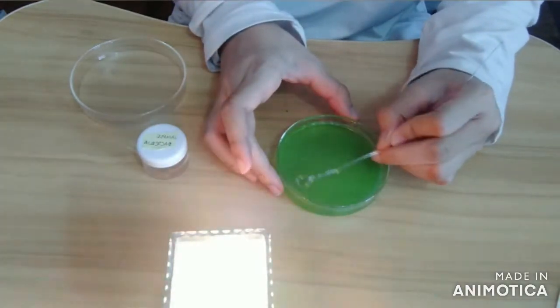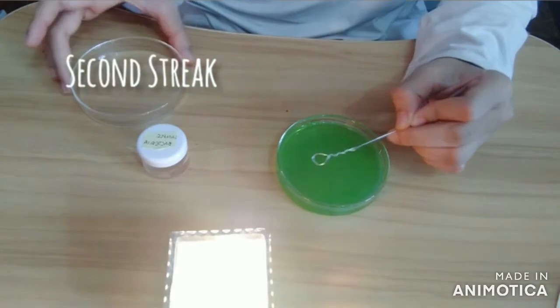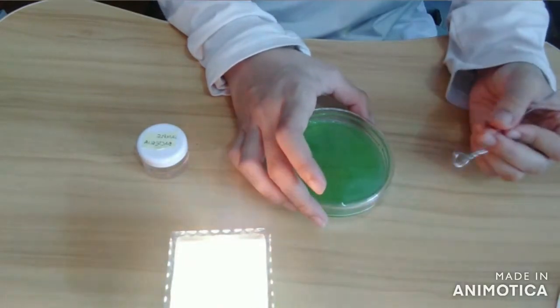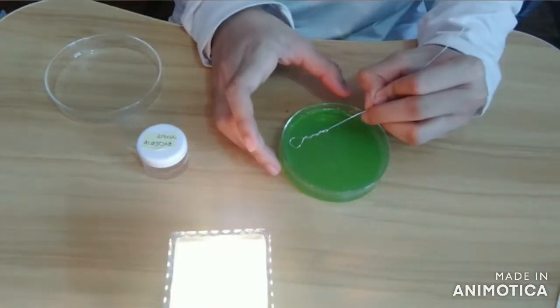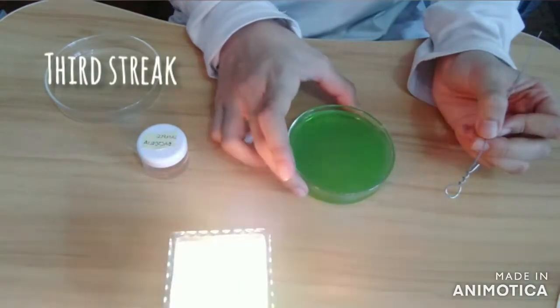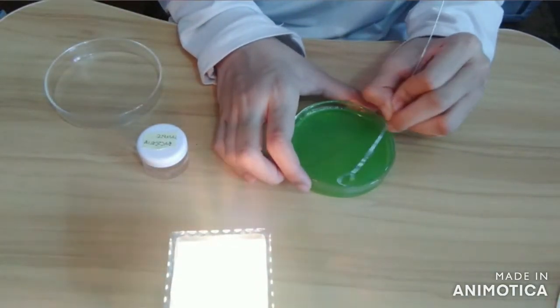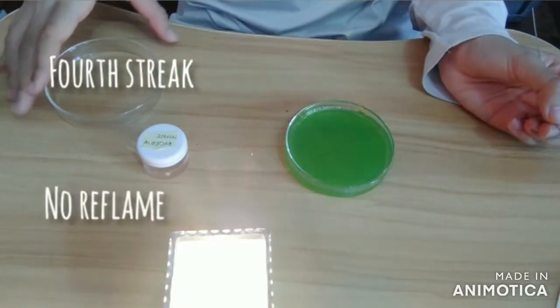Drag from one corner of the first streak and then drag it several times across the second area to create the second streak. Make sure not to let the inoculating loop touch any of the previously streaked area. For the third streak, do the same procedure as the second streak. But for the last, the fourth streak, there is no need to reflame the inoculating loop.